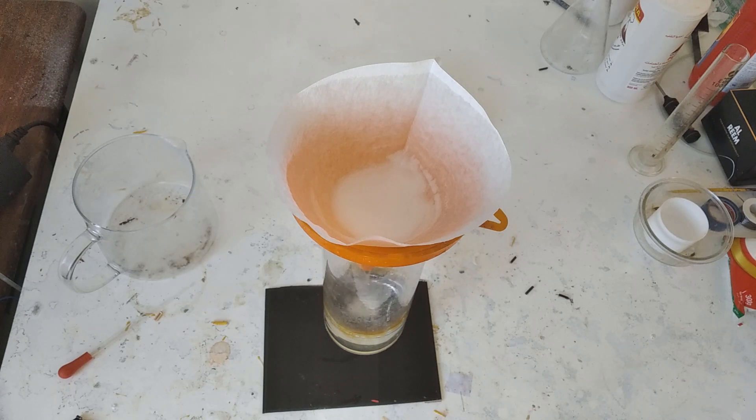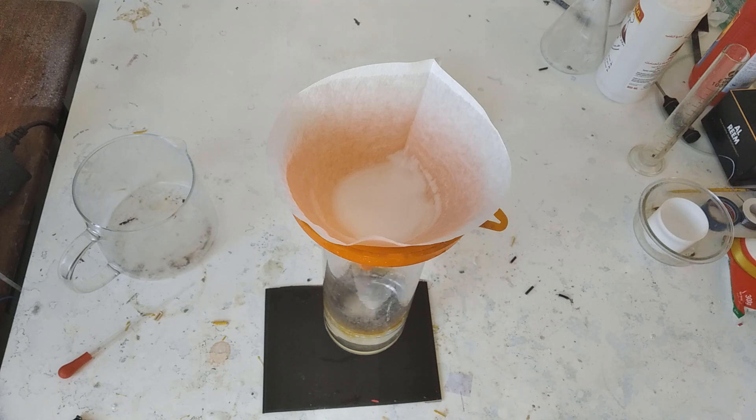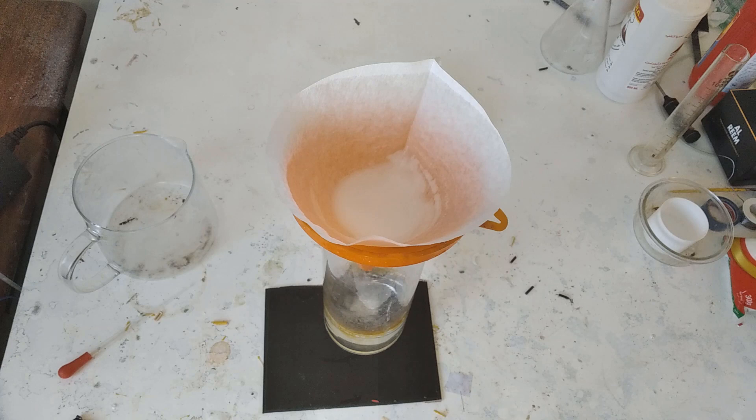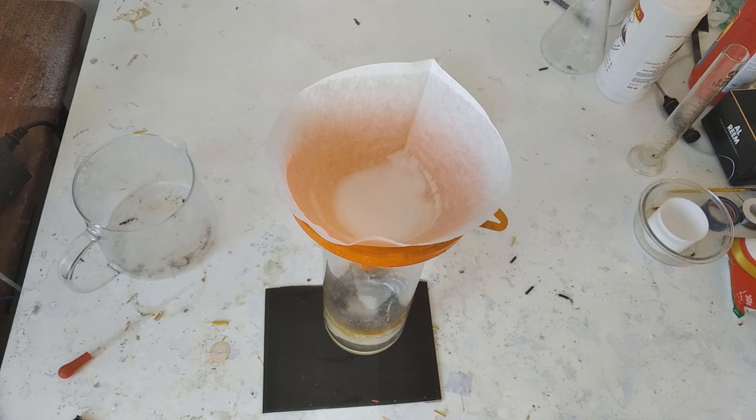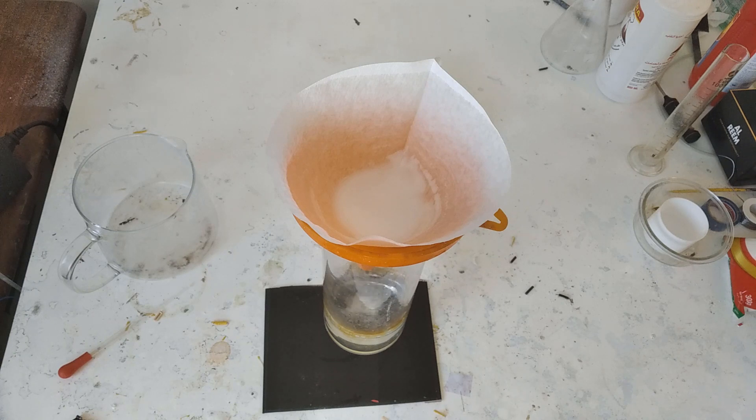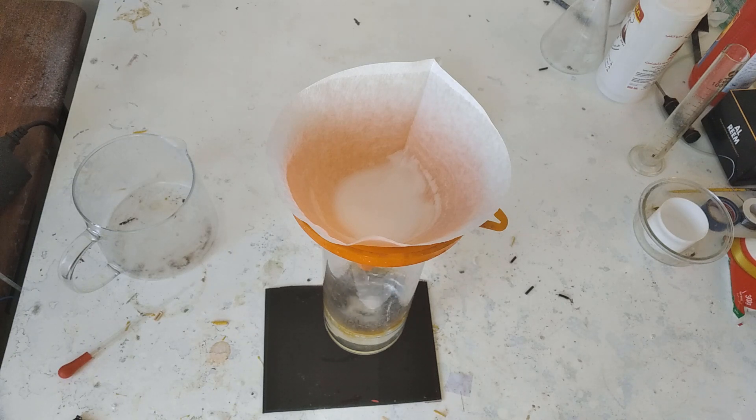it's not a very strong anion membrane because it's not in the quaternary form which is gonna be an amine though it can hold charges. You know it's not gonna be that great. However it's good enough for my purpose.